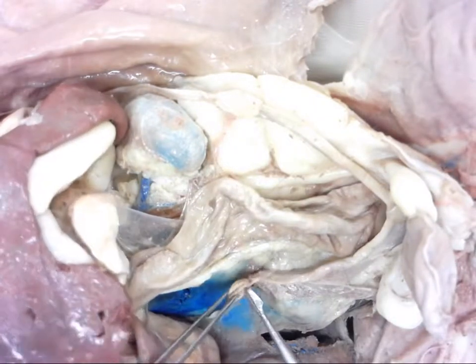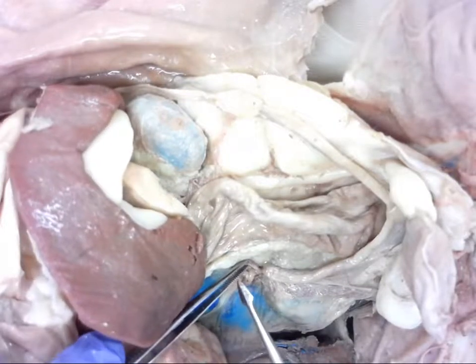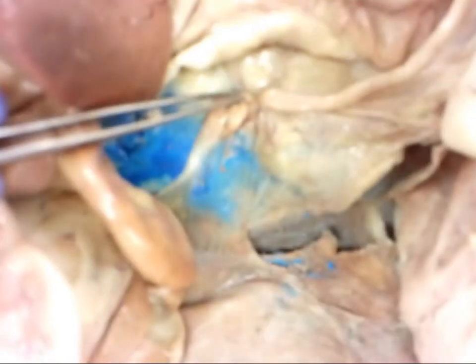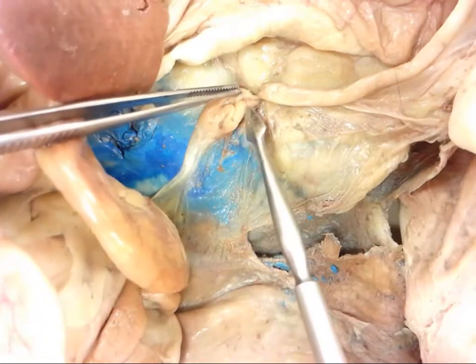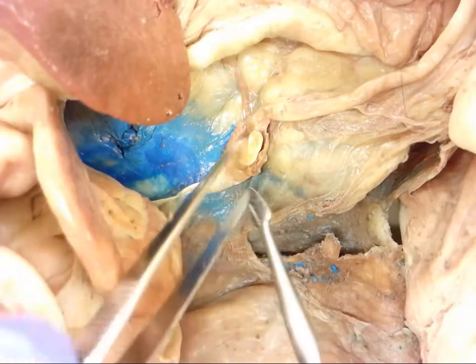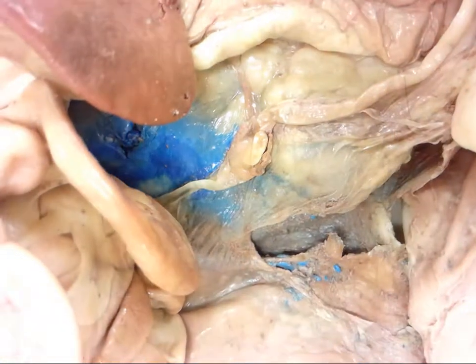Right inside, embedded in it, is the ovary - the site of egg production and ovulation. Then if we flip it over you can see a very small coiled tube on the back side - there's your fallopian tube - and it's going to lead into the uterine horn. We do also have a ligament that is going to help hold these to the abdominal wall.